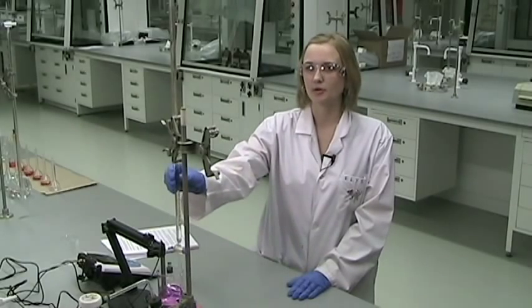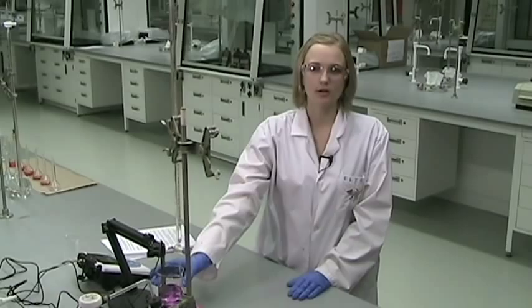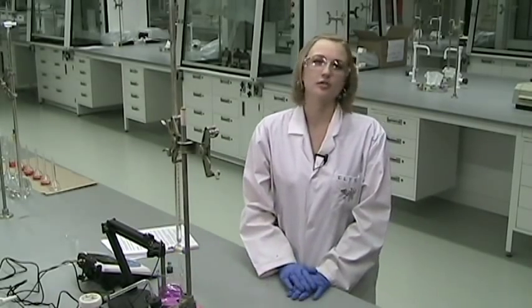So in this lab, you'll also be titrating an antacid tablet to try the weak base strong acid titration and testing how good of a buffer the antacid tablet is. The same principles apply. You will just have acid in the burette and your tablet dissolved in the beaker, and it will take a little bit more time after each addition for the pH to grow steady. But you will just give it, you know, one to two minutes, and you give it the same amount of time every time to consume the acid, and then you will take a pH reading and volume reading just as in this case.